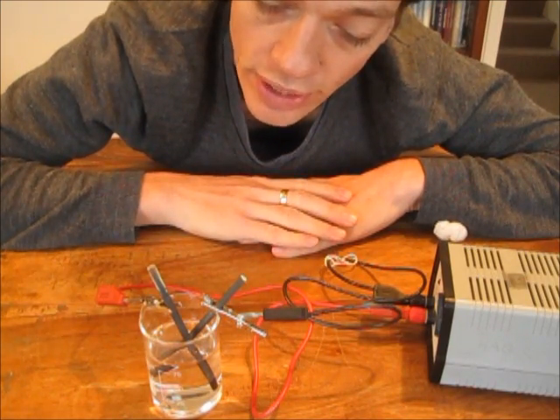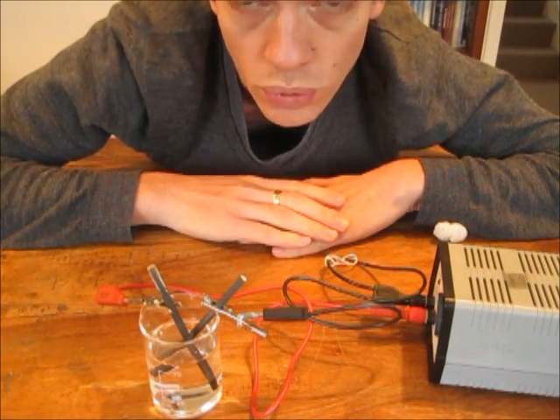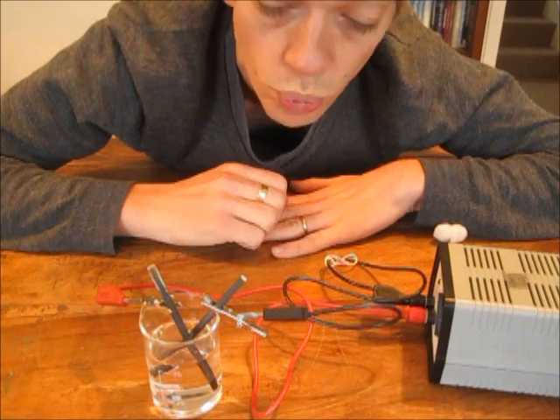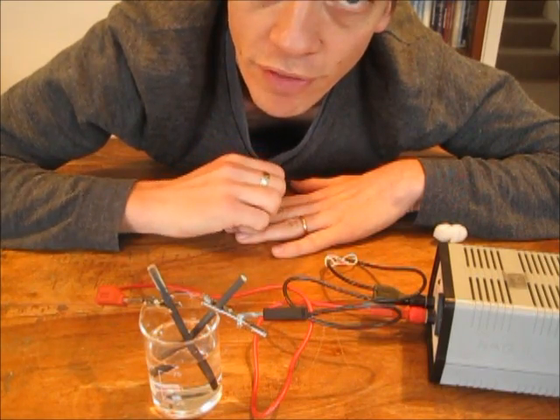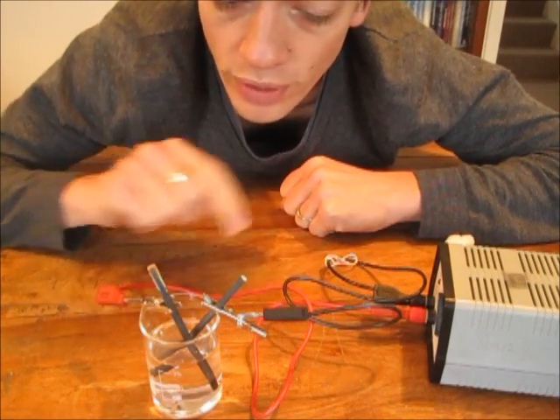I can change my electrolyte. Here I have salt solution but I can also use hydrochloric acid, or water, or a number of different substances to split it apart. What I have here is salt solution.